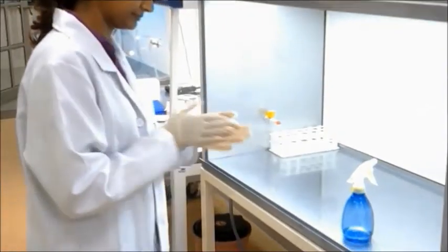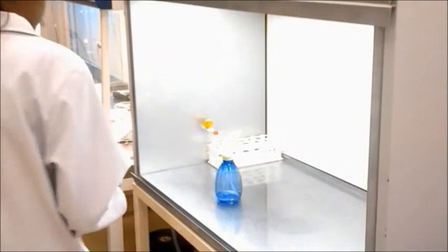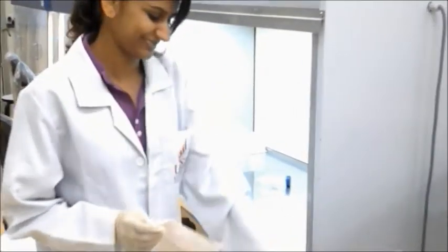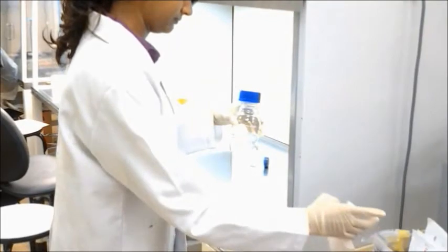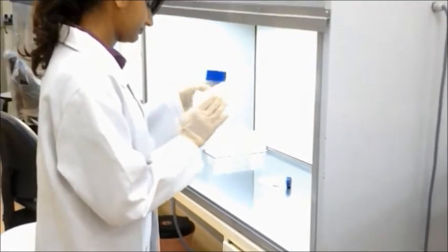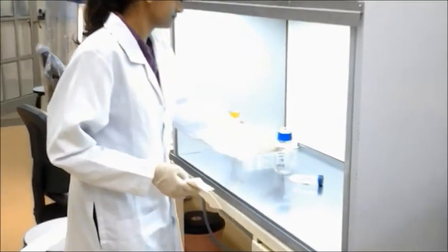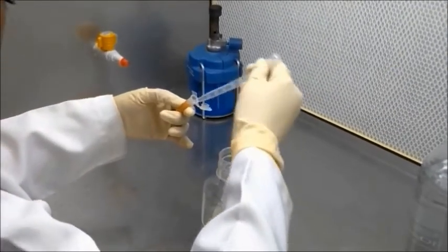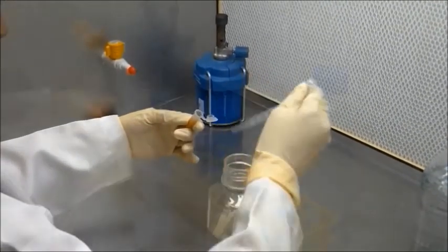Next is surface sterilisation. To create aseptic conditions for the culture, cleanliness and sterilisation are very important. The laminar flow hood where inoculation will take place is swept with alcohol before use. All materials are sprayed with 70% ethanol before transferring them into the laminar hood chamber. A Bunsen burner is used for sterilising inoculation loops, petri dish lids, and so on. Surface sterilisation begins with decanting the water from the seeds, then adding 95% ethanol to the seeds.